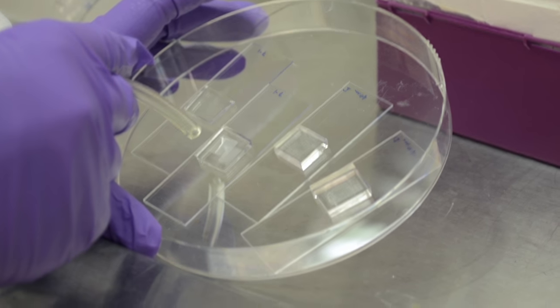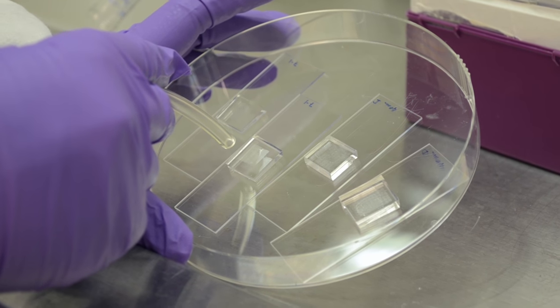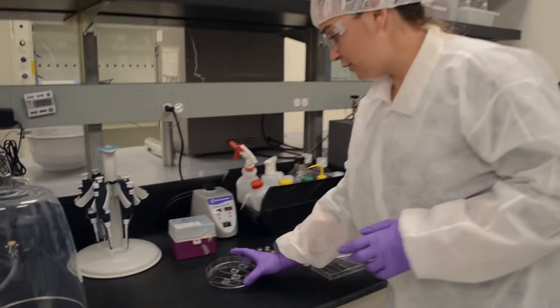It looks kind of like a coffee stain drying. Oh, yeah. I don't know if you can see that. I can actually on the camera. That's crazy. That's awesome. We're gonna take our dry stamps and we're just gonna put them here for a second.